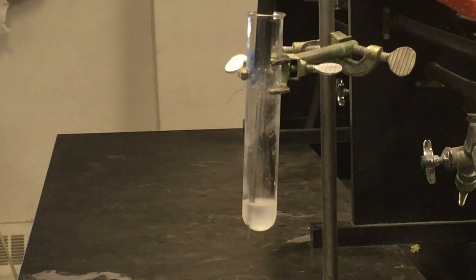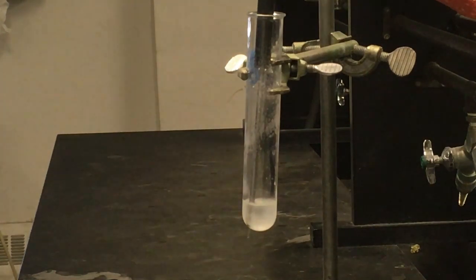And it looks like our solution's frozen through pretty solid already. So I'm going to cut this portion of the video off here, and then I'll show some video with all of our data displayed out like I have for the last couple trials here in just a moment.